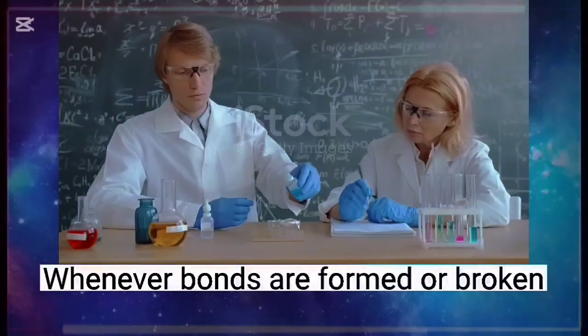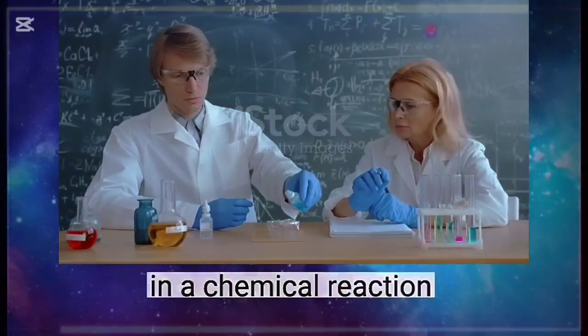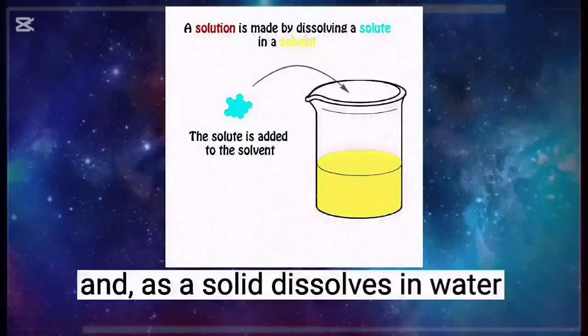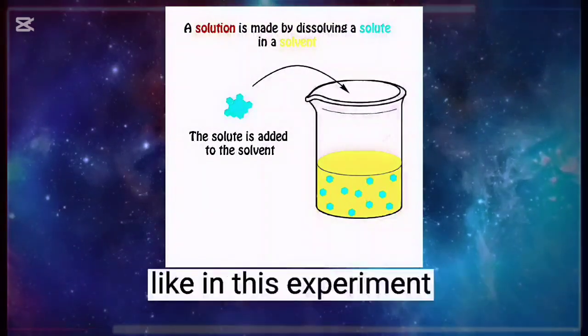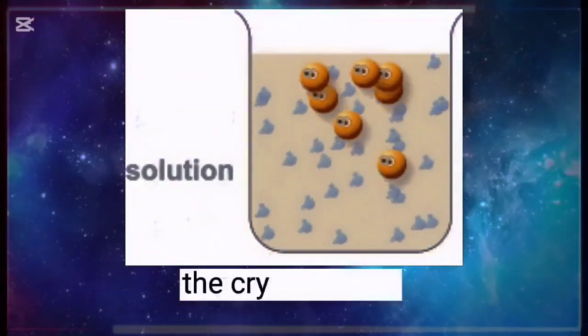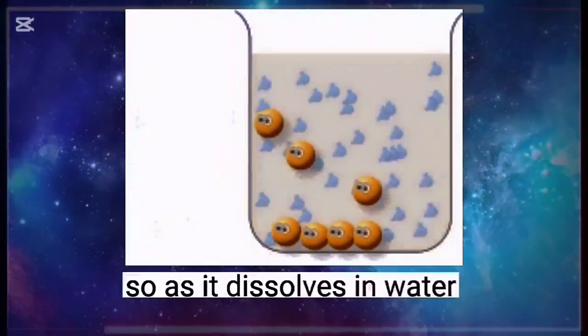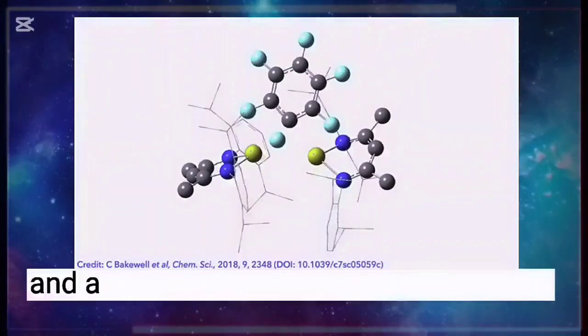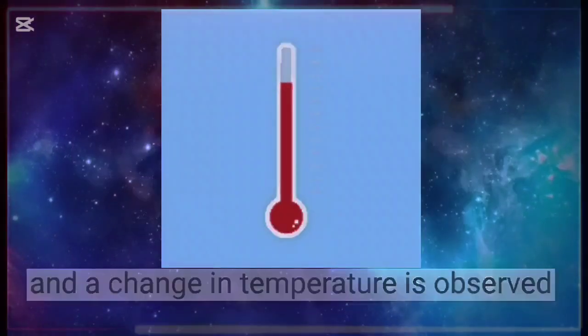Whenever bonds are formed or broken in a chemical reaction, energy is transferred. And as a solid dissolves in water, like in this experiment, you have sodium thiosulphate, which is the solute, the crystals. As it dissolves in water, its bonds are broken and a change in temperature is observed.